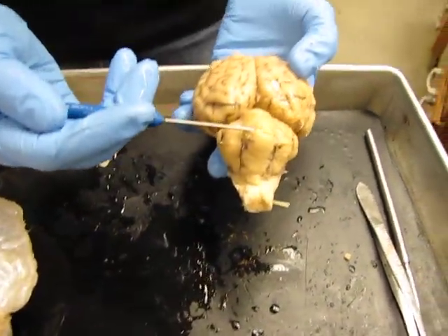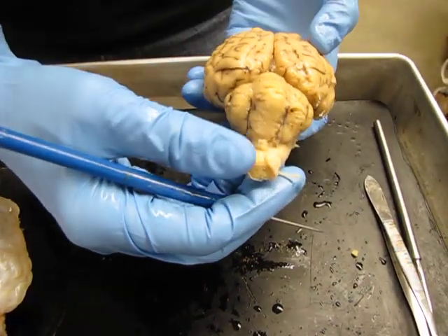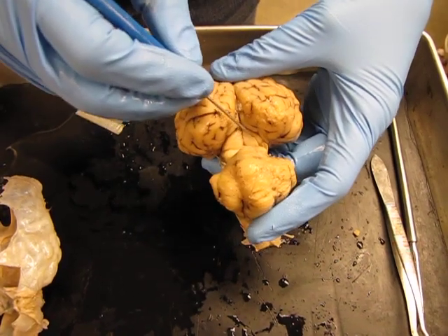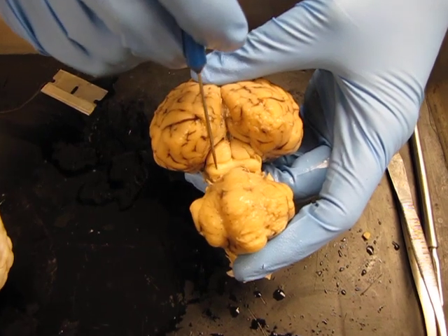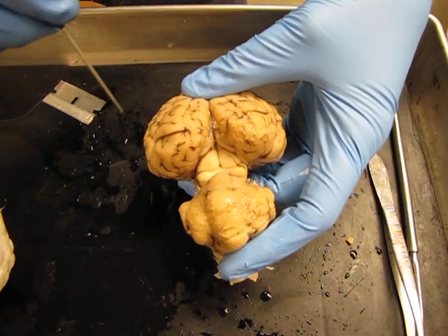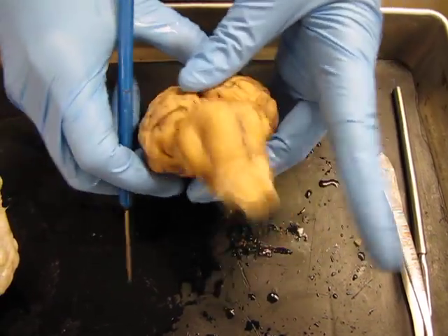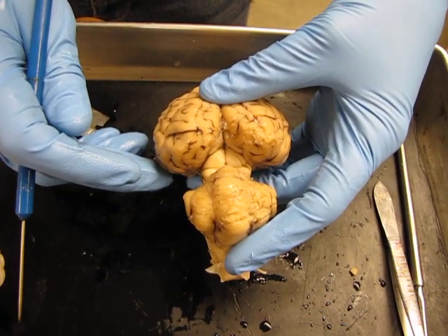In the back you can see the cerebellum, and the cerebellum also has sulci and gyri, but they're smaller than they are in the cerebrum. If you separate the two sides a little bit and push down on the cerebellum, you can see a structure that looks like two round bumps and then two smaller bumps underneath. This is called the corpora quadrigemina, which means four twin bodies, also called the superior colliculus and the inferior colliculus. That part is the top of the brain stem, especially the part called the midbrain.